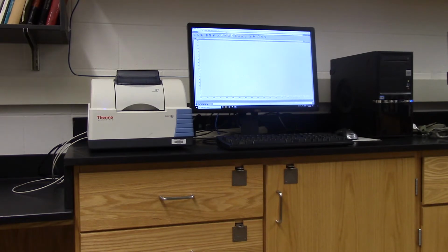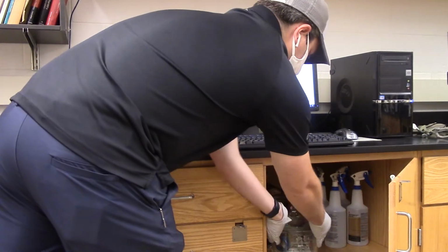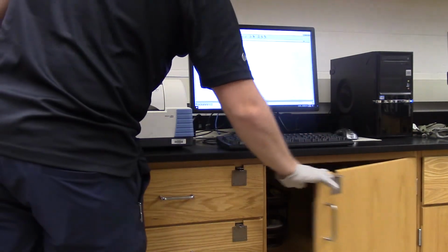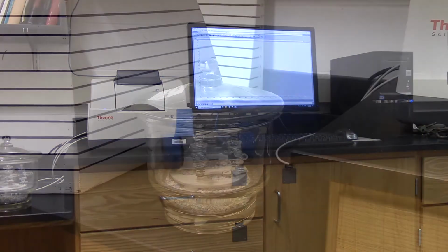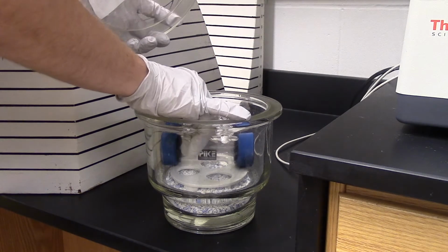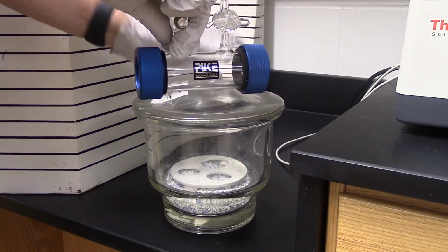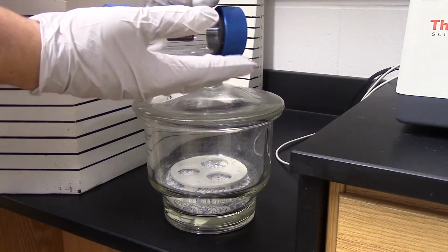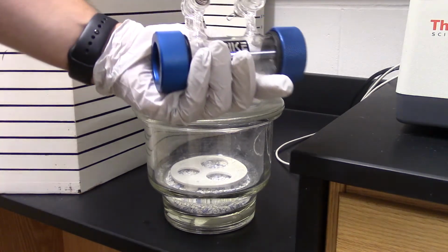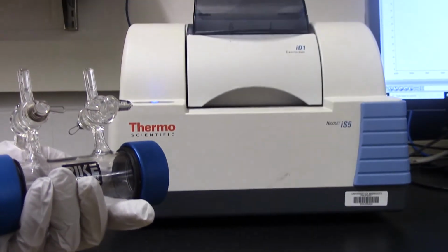This is the FTIR instrument. The sample cell is stored in a desiccator, which you can find in a cabinet underneath the computer. This sample cell is likely different than for FTIR measurements you may have made in the past. The body and inlets are made of glass to contain the gaseous samples, but the windows at both ends are made of potassium bromide, which transmits IR light. These are very moisture sensitive, so please make sure not to touch them and store it in the desiccator when not in use.